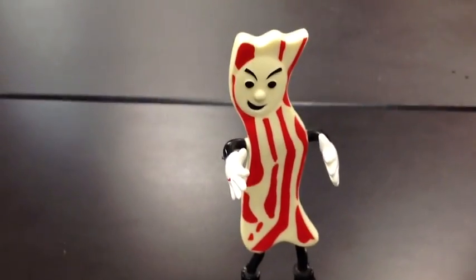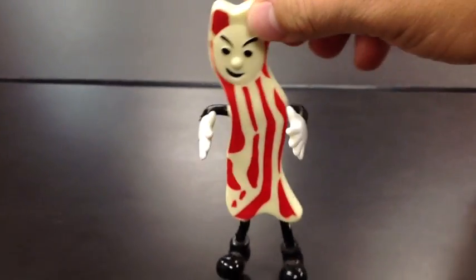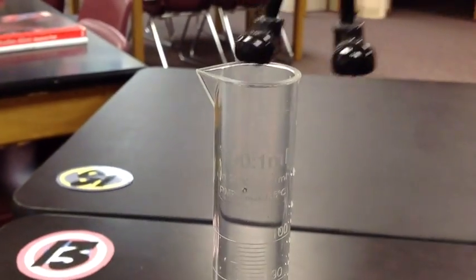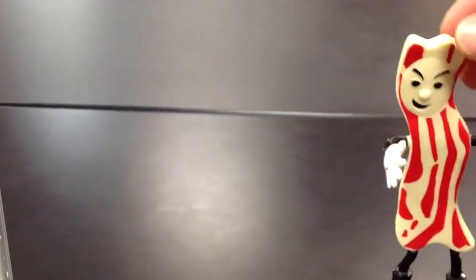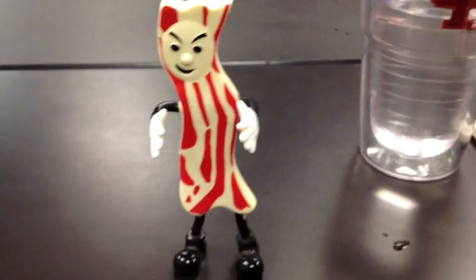We've got once again our good friend Mr. Bacon. Come on Mr. Bacon, let's go on in there and see what we can do. Oh Mr. Bacon, you don't fit in this graduated cylinder. Well, we're going to choose something else then for today's example.